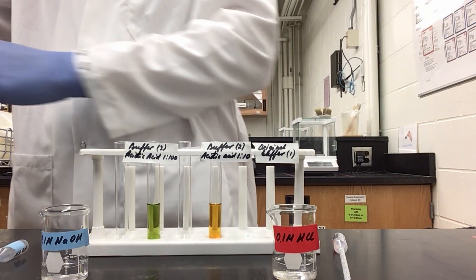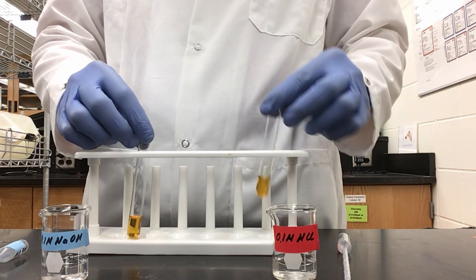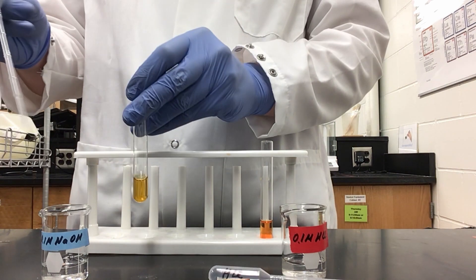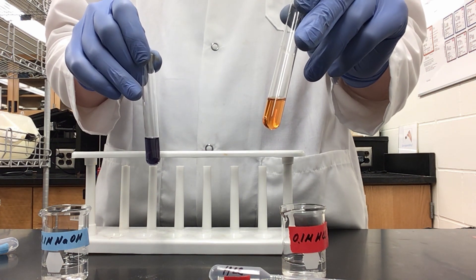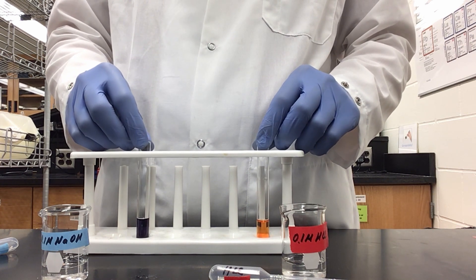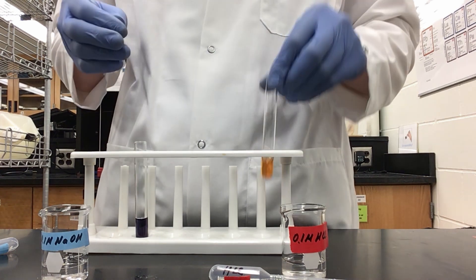Next, I'll move on and use my 1 to 10 dilution of acetic acid with sodium acetate, repeating as I just did with my original buffer. I will divide this dilute buffer into two parts. To the left, I will add five drops of hydrochloric acid; to the right, five drops of sodium hydroxide. My right one ended up changing from a light orange to a deep violet — we exceeded the buffer capacity and ended up going very basic. My left one changed from a light orange to a dark orange, meaning the buffer functioned momentarily but then started to lose its buffer capacity.